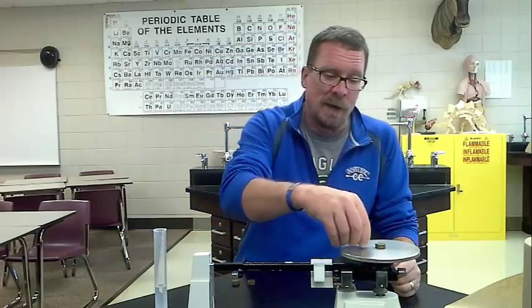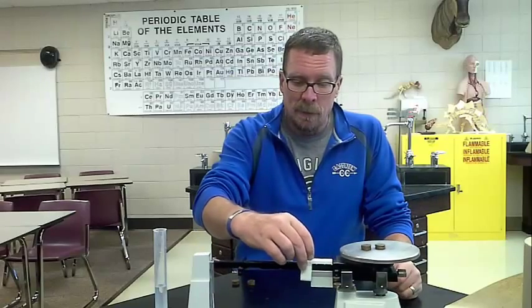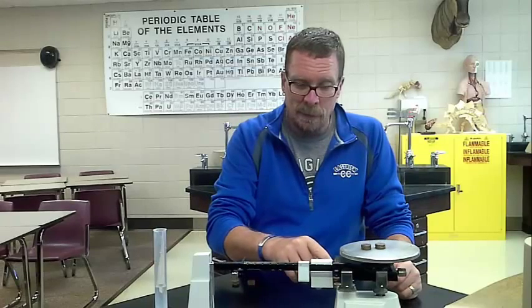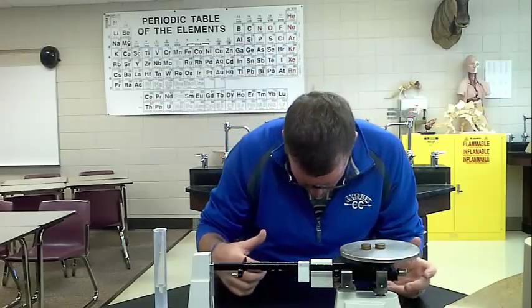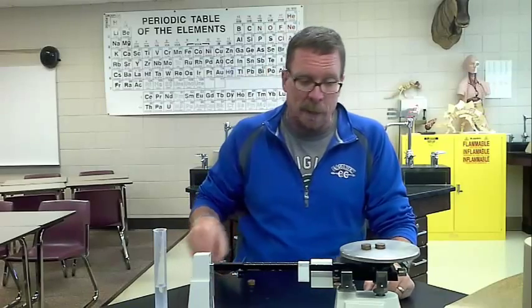I'm going to put another 5. And I'm going to test it again. And that gets me to 30.45. Put on another 5.